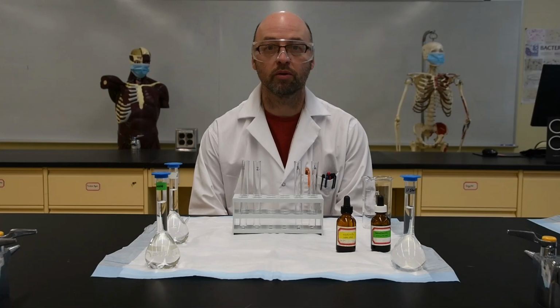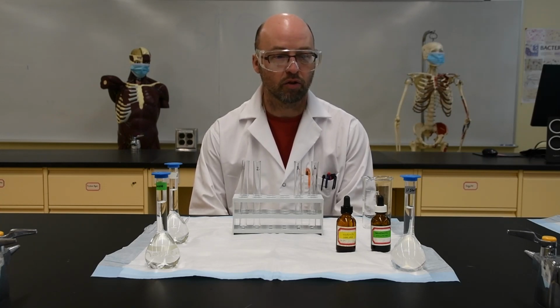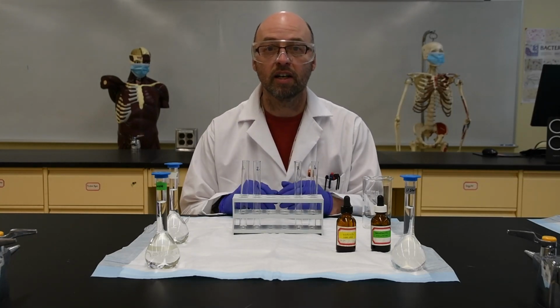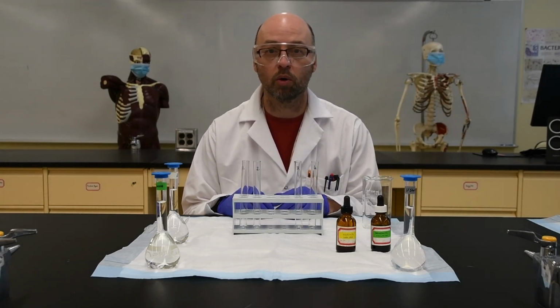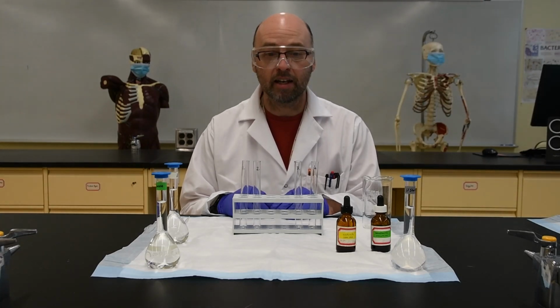Hello and welcome to the Biology Lab. As you know, this semester's General Biology 2 course will be conducted completely online. So that means that unfortunately you won't be able to come into the lab. But what we thought we'd do is have me come into the lab and film myself doing some of the experiments, and then you could see exactly what the experiments are, and then we could have a little bit of a discussion and maybe some questions about the results and the implications of the results so that you will understand what's going on. Today we have a simple diffusion experiment.